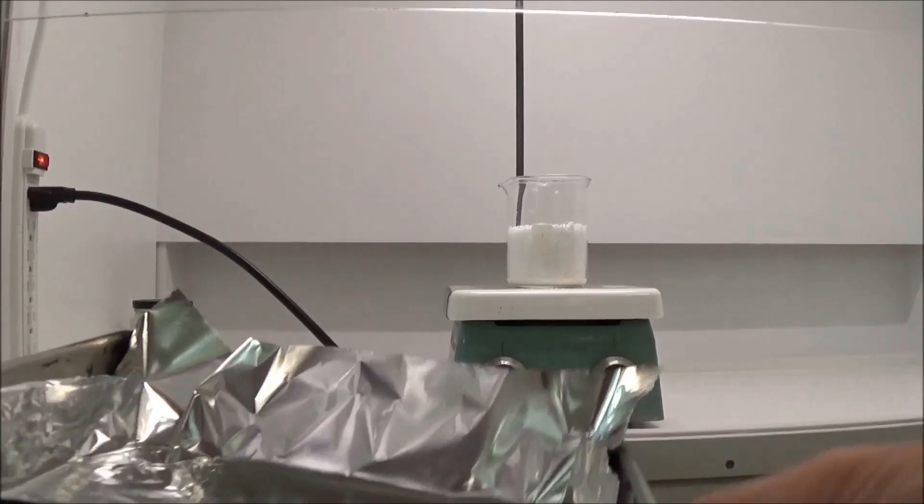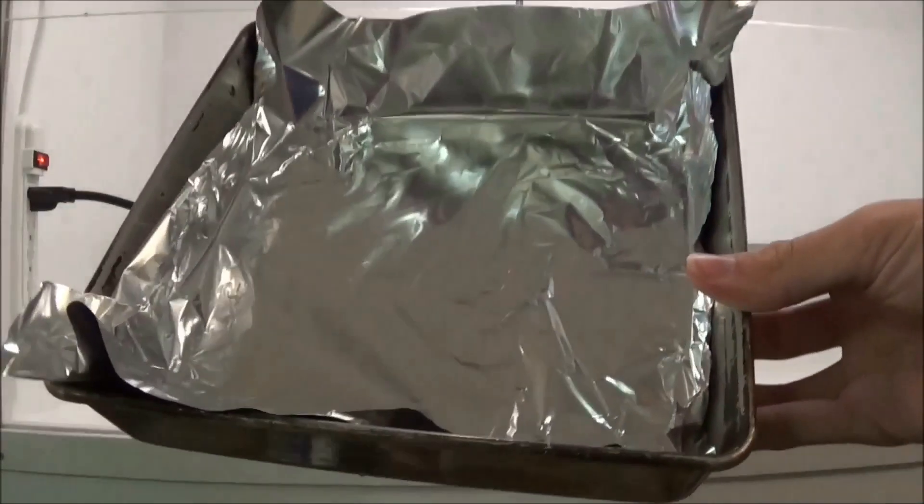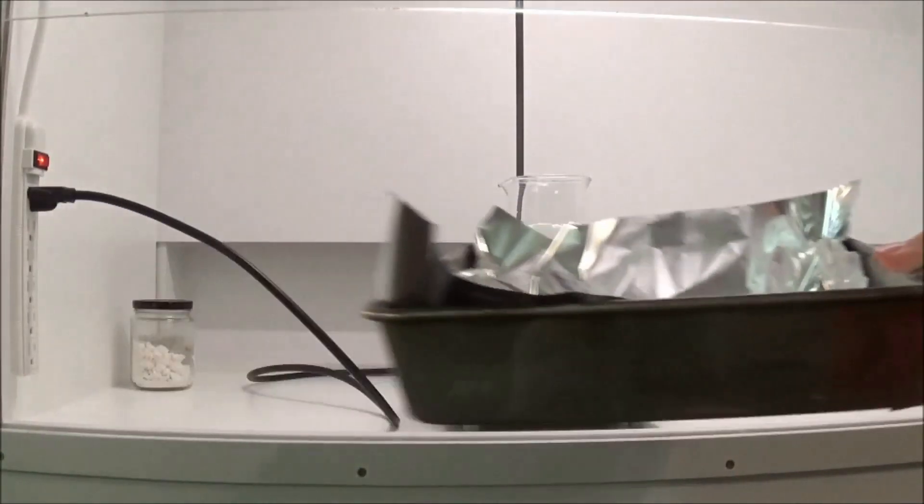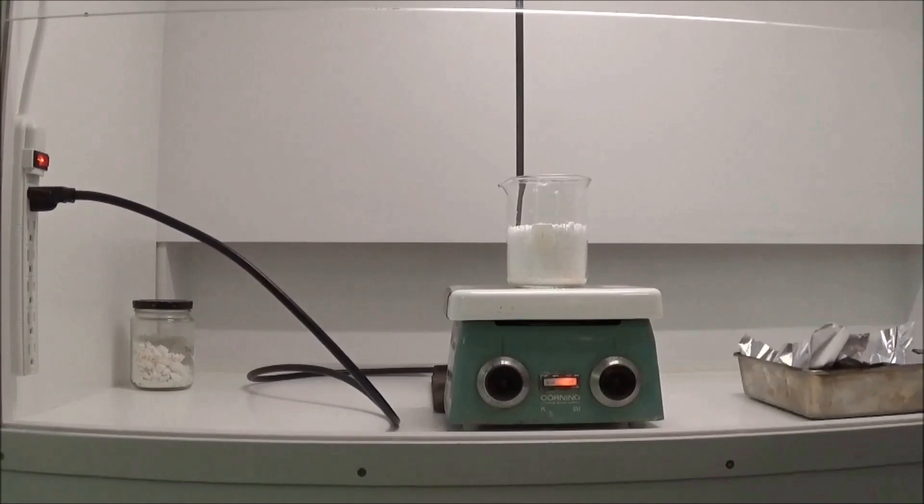As it began to heat up, I placed a piece of aluminum foil in a metal pan and set it aside for later when I want to collect my product.